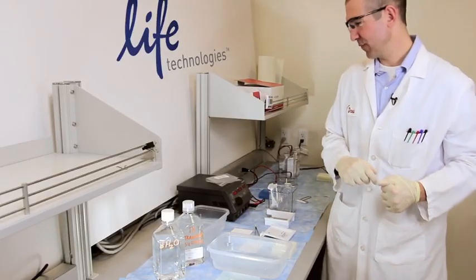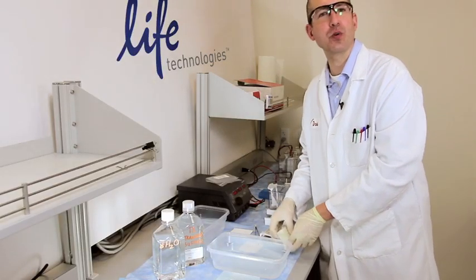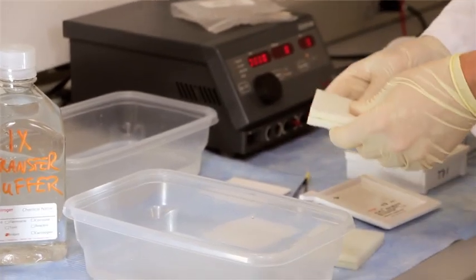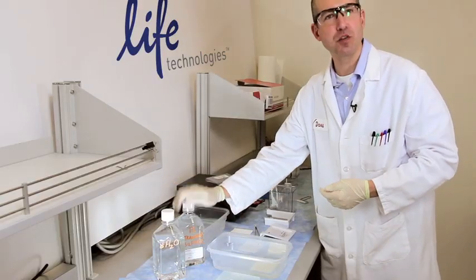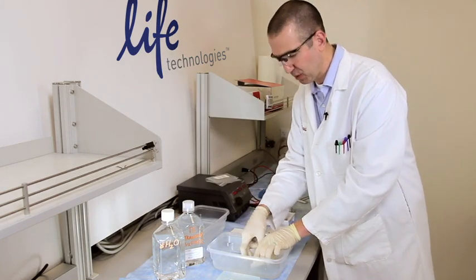Okay, so let's get started. First of all, we need to go ahead and start with our stack assembly. So we take two of our sponges and dip them into some of the transfer buffer that I've already poured into this plastic container.